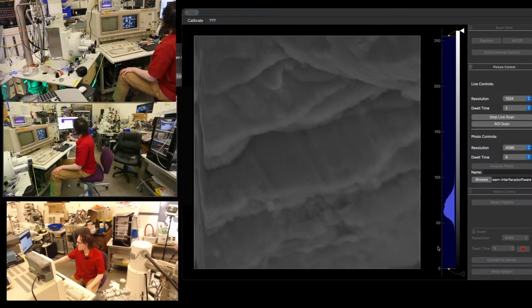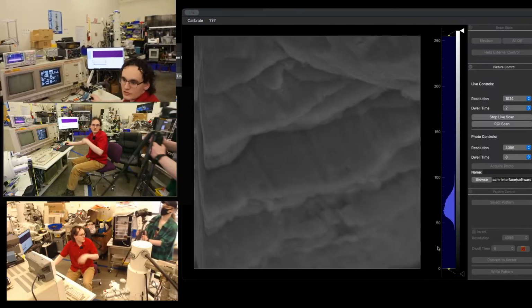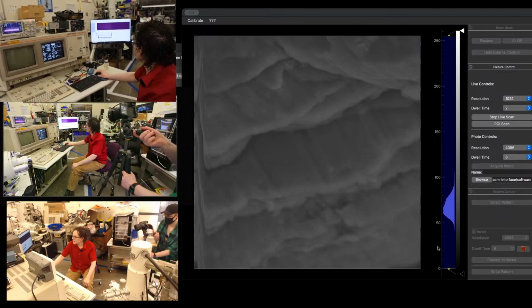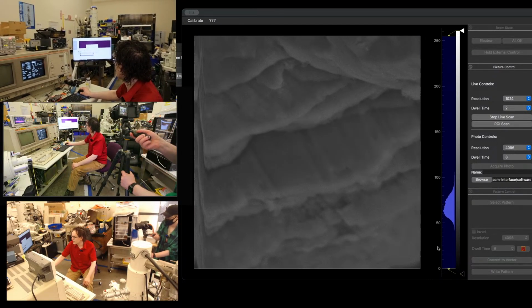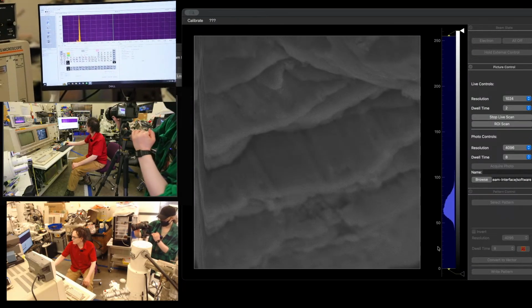And let's run a spectrum on it. So if you want to point at this screen here, this is our Noran software. We can zoom in on this one. We'll go ahead and do spectrum, and we'll hit the start button. That's going to ask us some questions. We're at 15 kV. Magnification doesn't really matter. We are at 50 millimeter working distance, so we'll go ahead and close that, and that will start our acquisition.